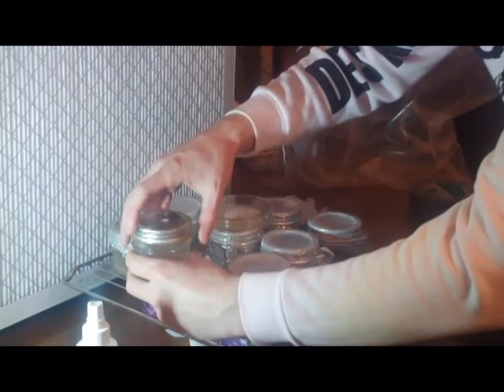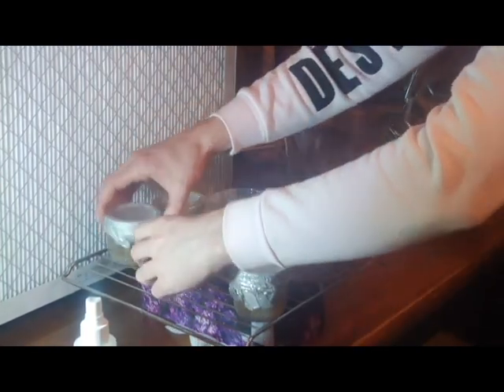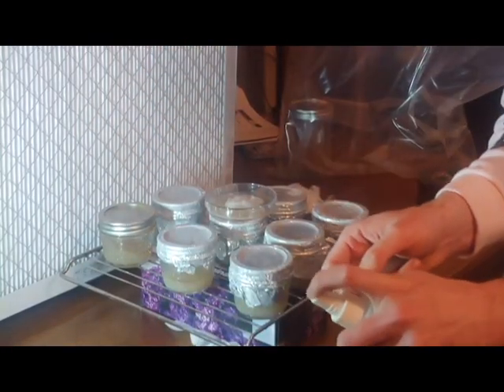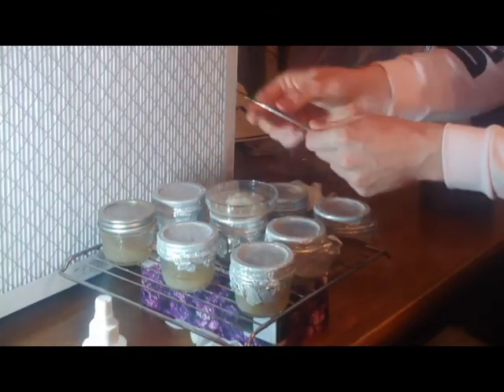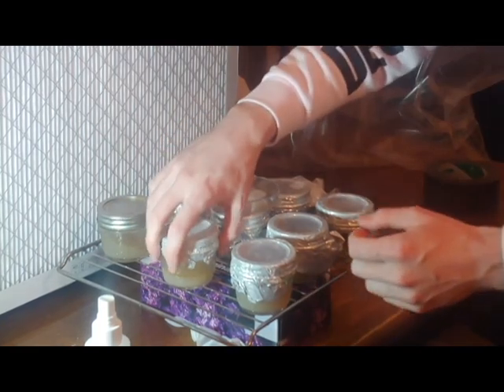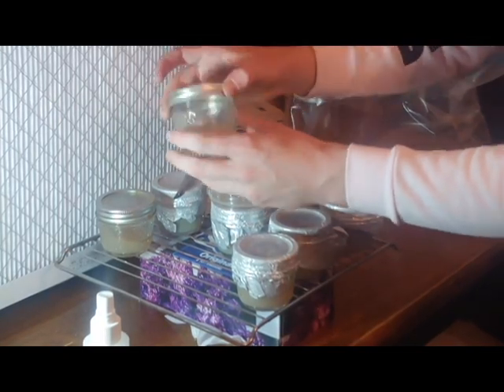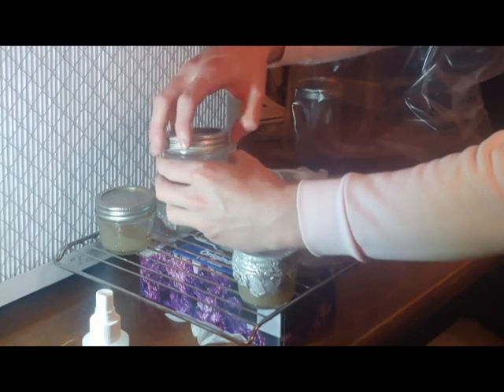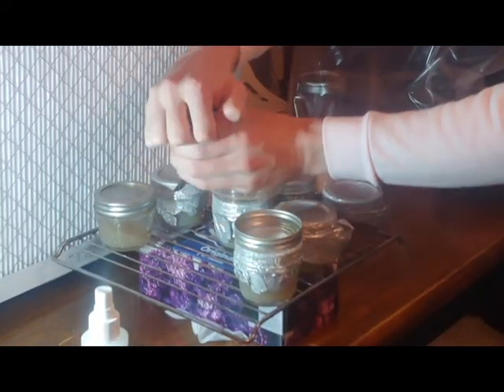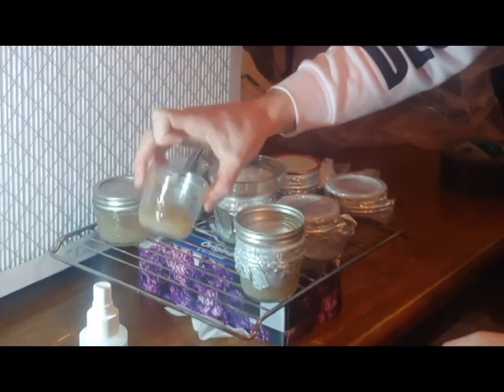This is key for any situation. A common practice is to sterilize the scalpel between each transfer so that you're not contaminating each agar dish. Some agar dishes may have contamination on them and you just want to make sure you're not going to mess up your whole work. It hasn't happened to me yet, but it may happen because sometimes you just make mistakes. If you make a mistake, just learn from it for future sterile work.